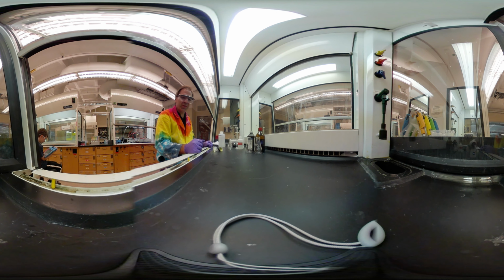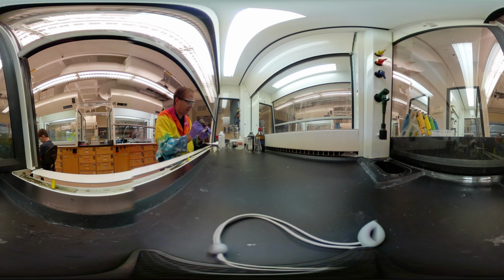So stock solution A, we're going to put all of our product. So we can see our yellow product here. And I've got it on 2 filters. Remember, it was going really slow. This took much longer than I expected to dry this thing. It doesn't actually have to be 100% dry because we're going to add an aqueous solution of sodium hydroxide to it. The drier it is, the better the IR.